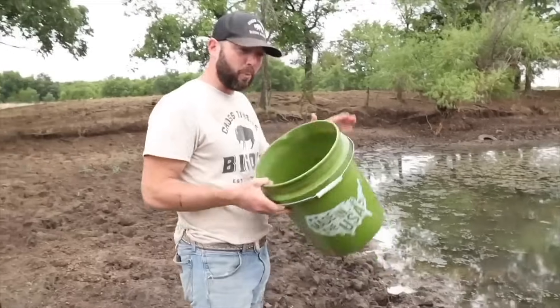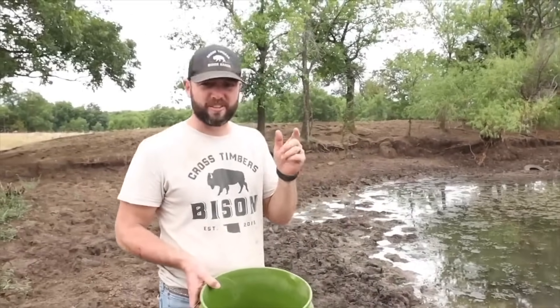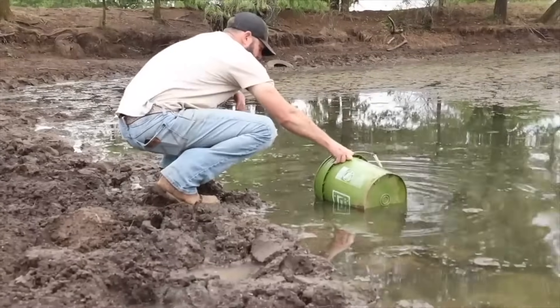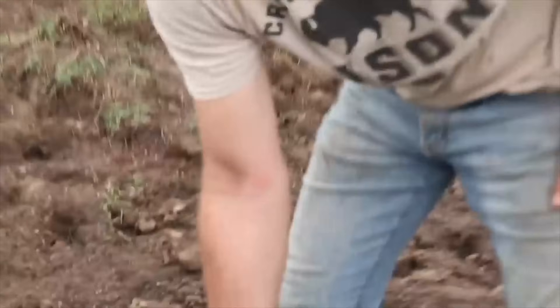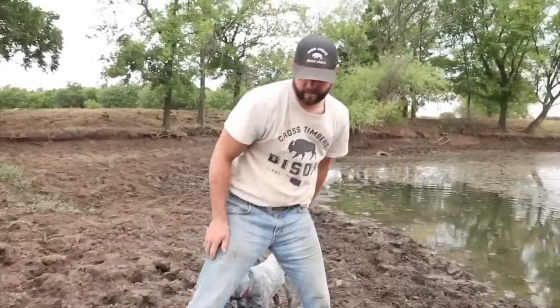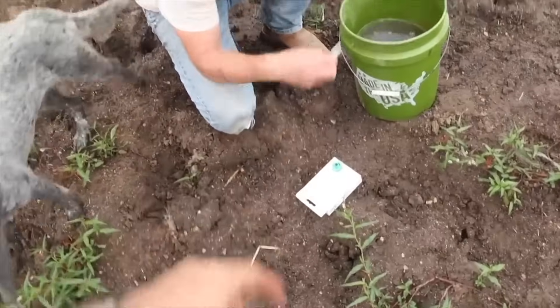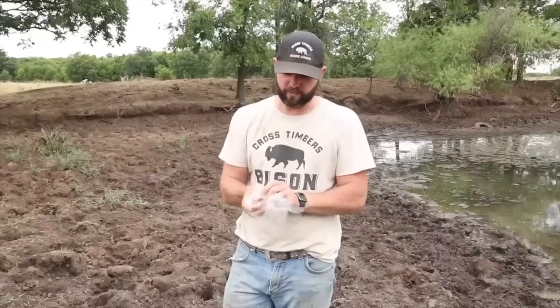I'm going to get some water in our five-gallon bucket — not the whole thing, but enough to stick your hand in. You've got to put that glove on. First you have that little white thing — put that over the hand that you're going to dip in there. Hold it at 45 degrees, the whole thing underwater.